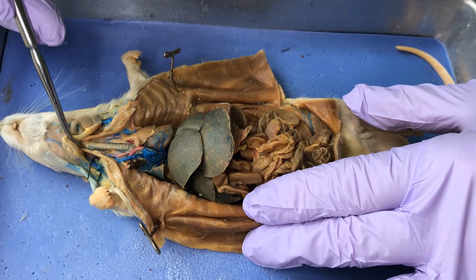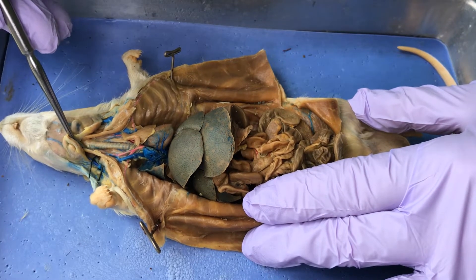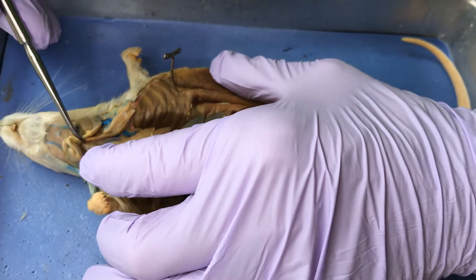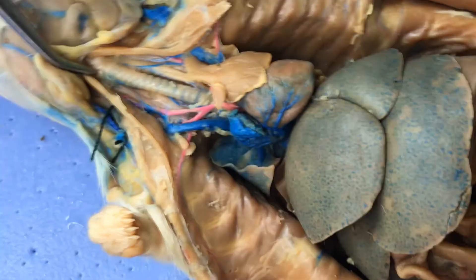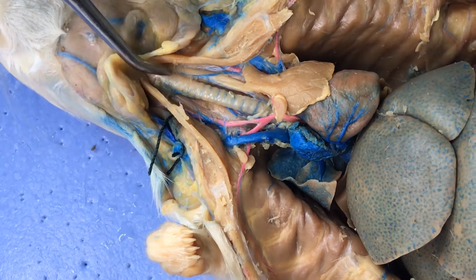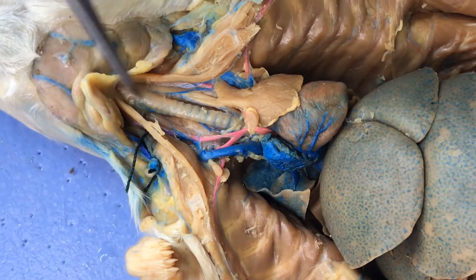Way up here at the cranial end of the trachea you can see a little swelling and some white dots. That swelling is the larynx, the voice box. The little white dots right there — that is the thyroid gland. The thyroid gland kind of wraps around the trachea right here, so anything pointing way up at the top of the trachea in this section will be the thyroid gland. The parathyroid glands are embedded in there but you can't see them.